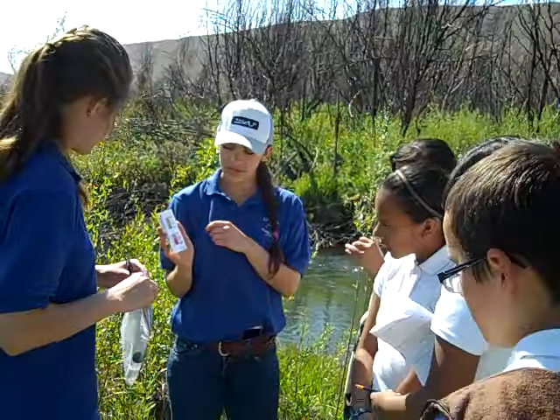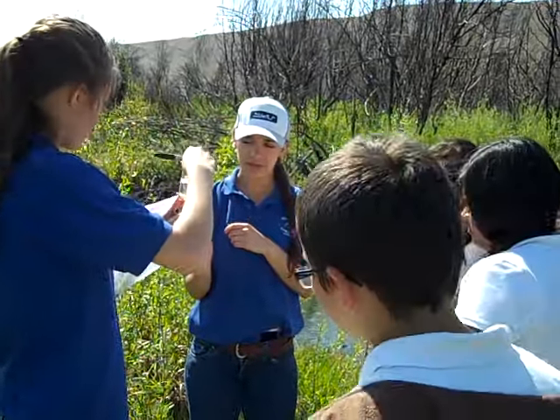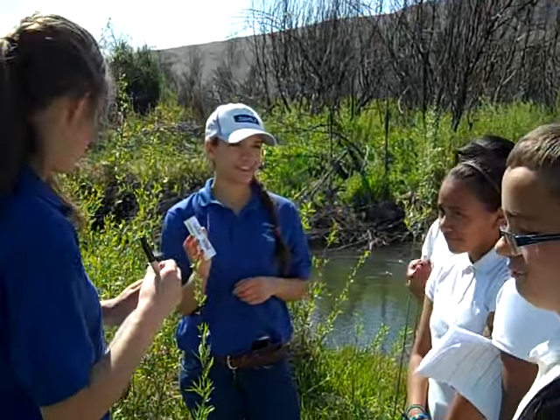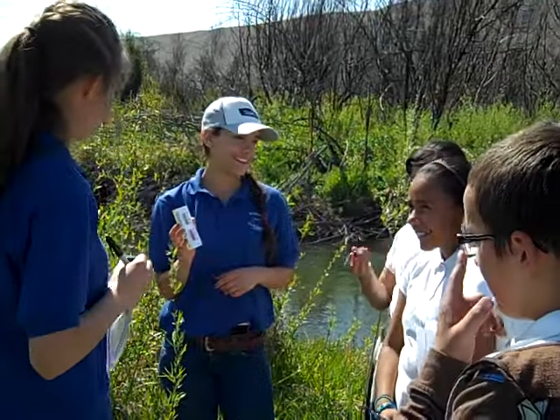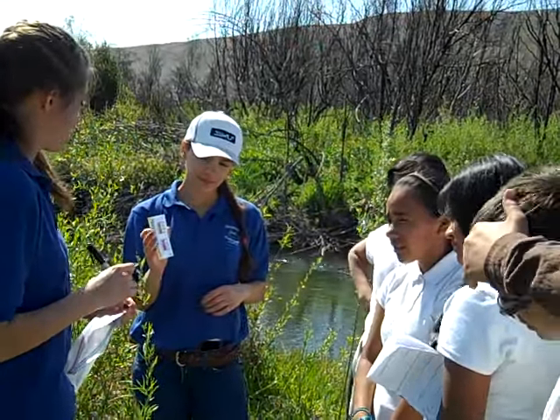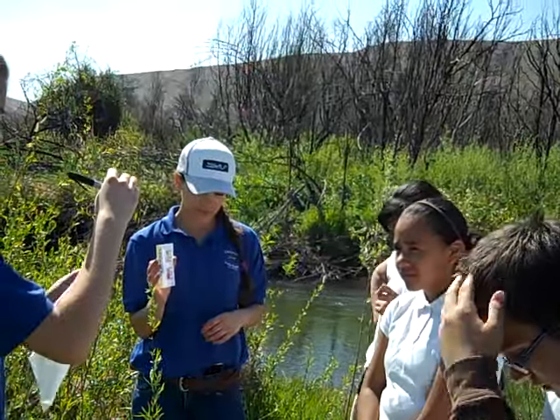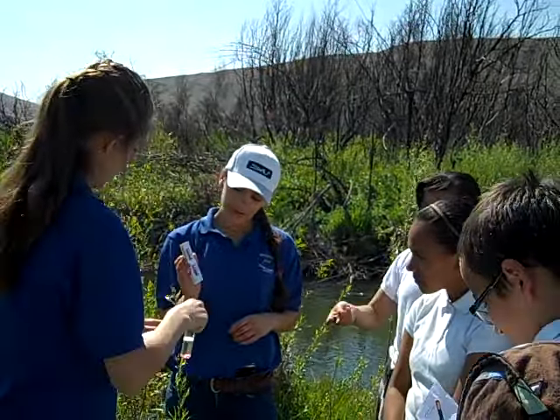That tells you, okay, so this is coliform bacteria. I gotta explain it. Does anyone know where coliform bacteria comes from? Comes from poop. Comes from animals and people. So, it's a bacteria. It's not really harmful in small amounts. It's going to be in most creeks and lakes, but you guys will see if it's in there or not. It'll turn either red or yellow.